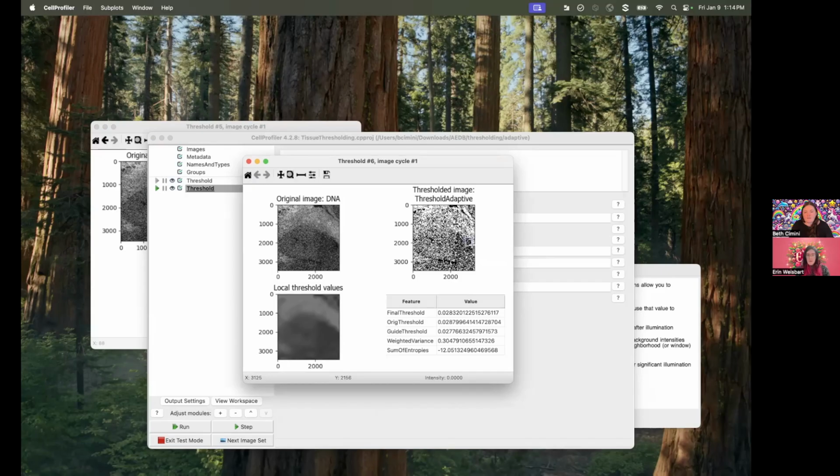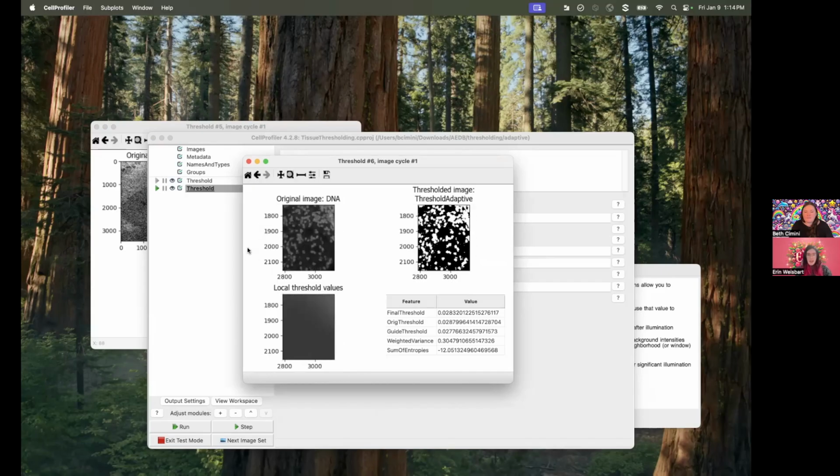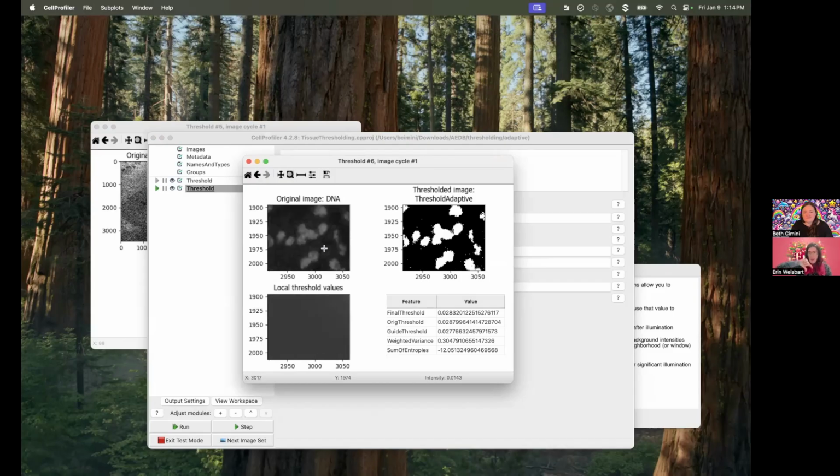And so if I zoom in, I love that because you can see the pattern of the threshold values matching the pattern of the brightness. And so immediately you can have this intuition of, oh yeah, that worked, or that certainly is going to work better than my global thresholding. If that pops up and your patterns are not matching, you know before you even dive in that you need to adjust your thresholding window or some other settings, because they should be similar.